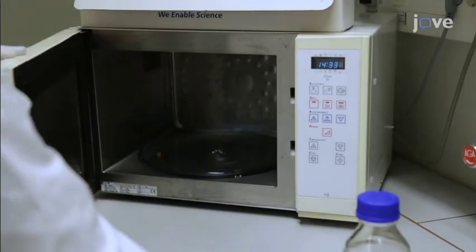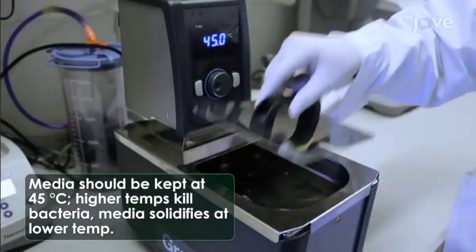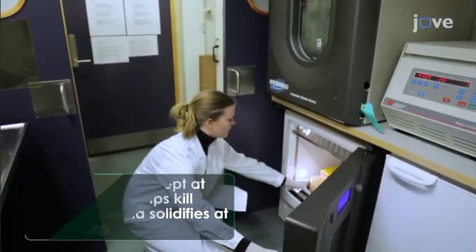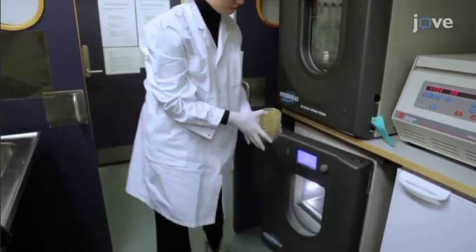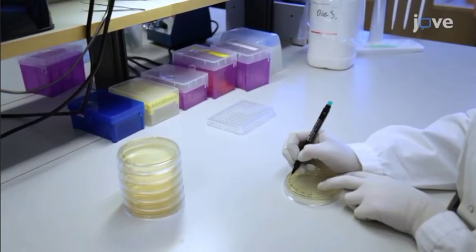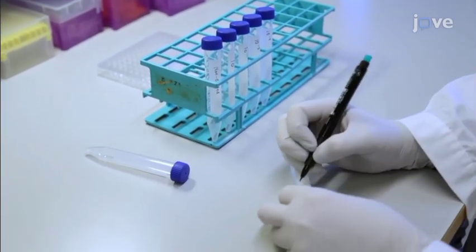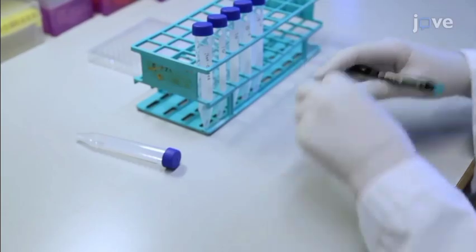Next, melt the solidified LB top agar using a microwave. Then place it in a water bath that is preset at 45 degrees Celsius for 1 hour. After 1 hour, collect the Petri dishes containing the bottom agar layer from the incubator. Label the plates with phage concentration and assay date. Then set out 7 clean test tubes. Label each test tube with the serial phage dilution number and designate one as control.